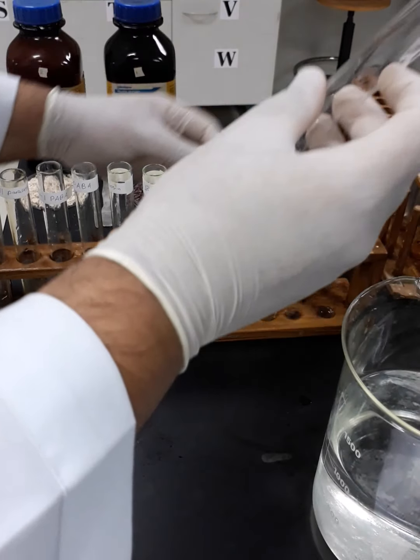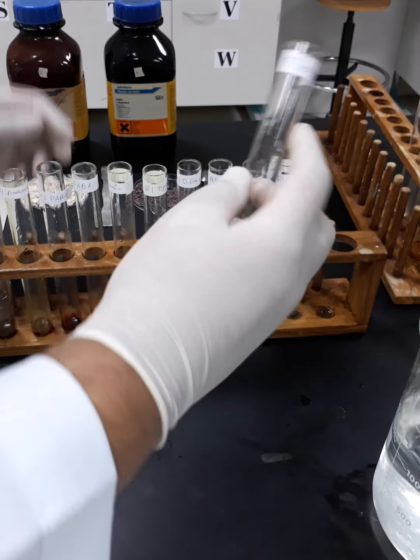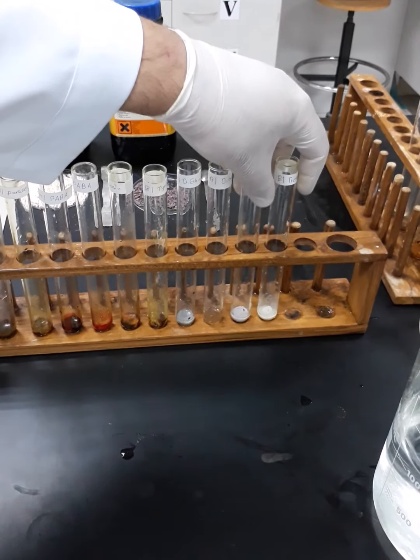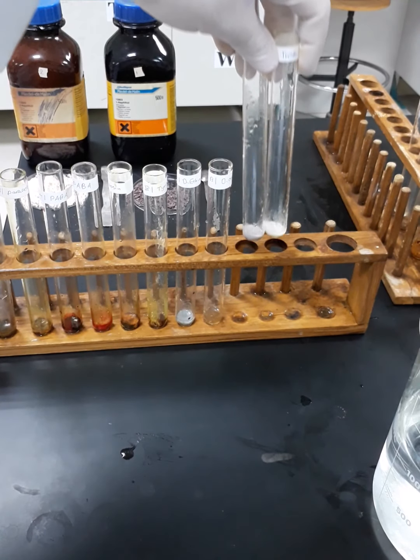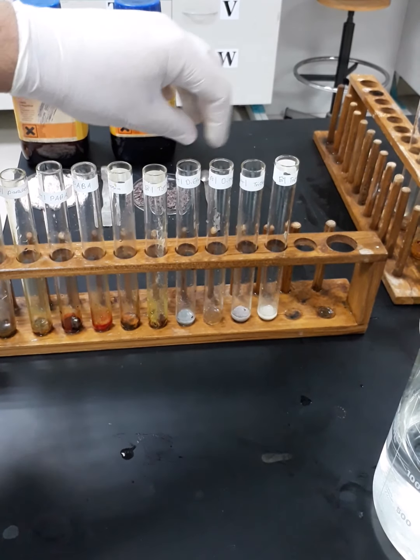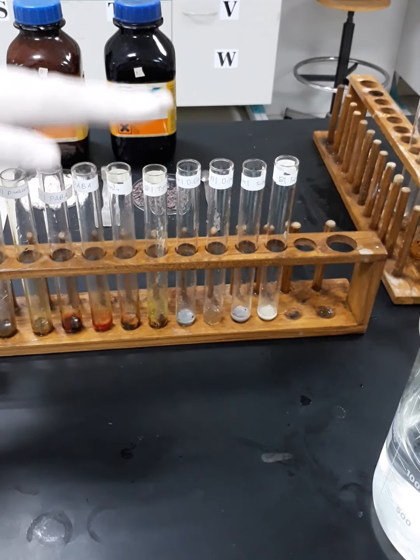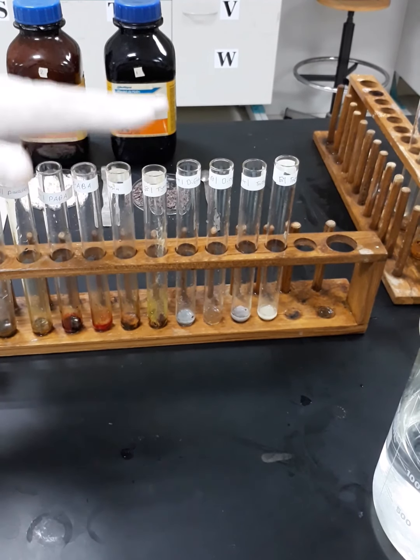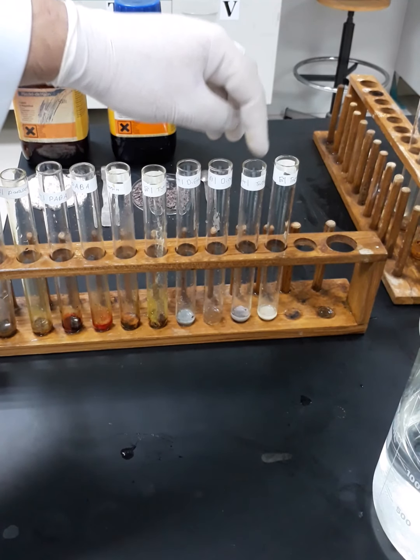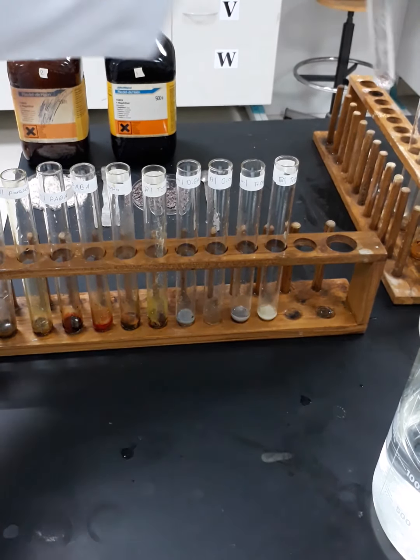to the last sample, which is triethylamine, and these are the two test tubes of triethylamine. Okay, and we are going to observe. We can see that in diethylamine and triethylamine, yes, the same scenario between alpha and beta, but the color is not very characteristic. The colors are very characteristic for these three amines which contain a benzene ring. But here we have the same scenario, which is the difference in the depth of the color between alpha and beta in this test tube.